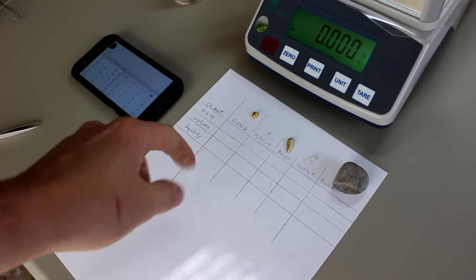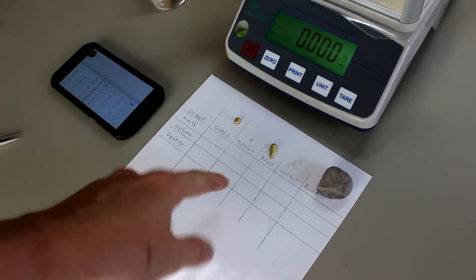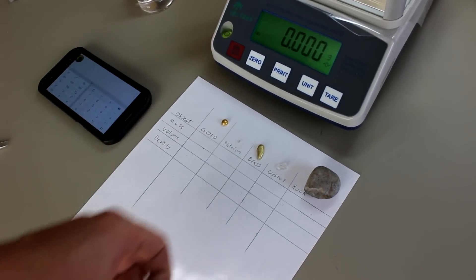Hi everyone, welcome back to Cody's Lab. So today I'm going to show you how to measure the density of small, irregularly shaped objects.